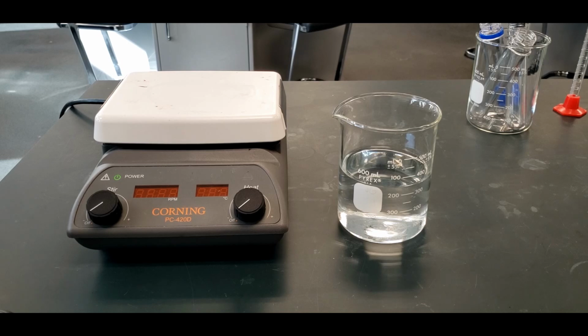So nothing's going to seem too connected in this lab, but once we have all the data, when we do the calculations, it'll make a lot more sense. But it has to be done this way. It's a fairly complex set of things going on here.